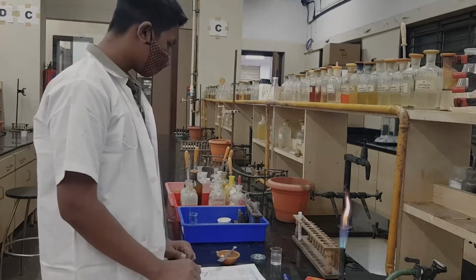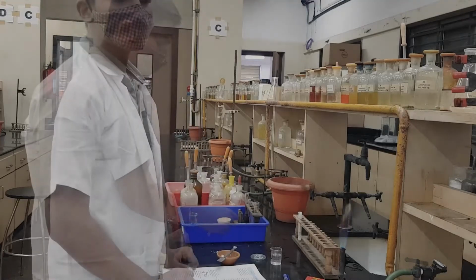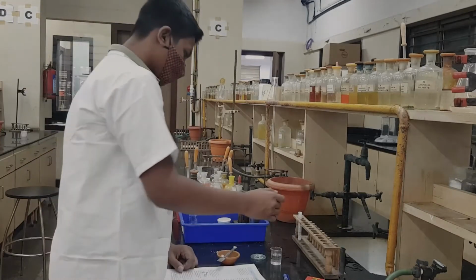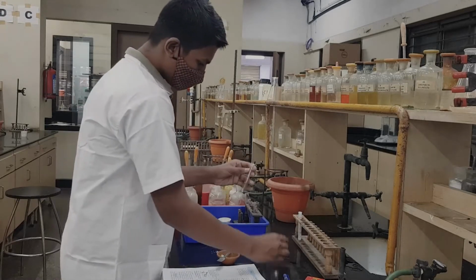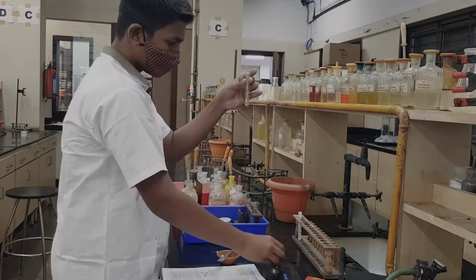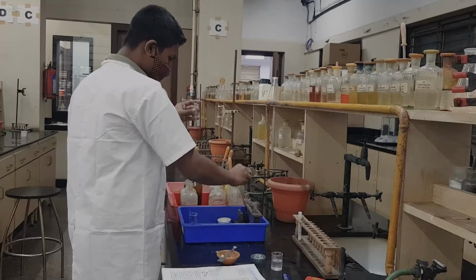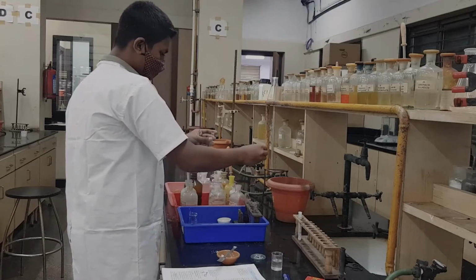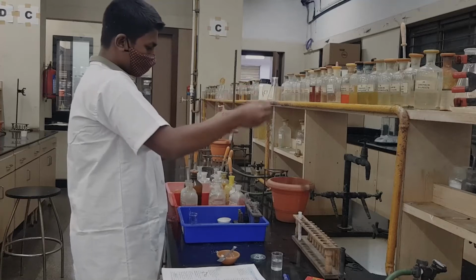With this original solution we are going to perform the wet test, and when performing the wet test, first comes the analysis of group 0. You repeat the test you did in the dry test, now with the wet test. Instead of the mixture we take OS, and to OS we add NaOH, sodium hydroxide, again. We are repeating the same test you did in the dry test.